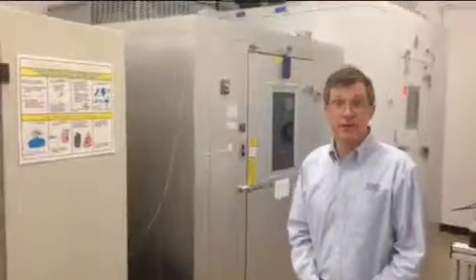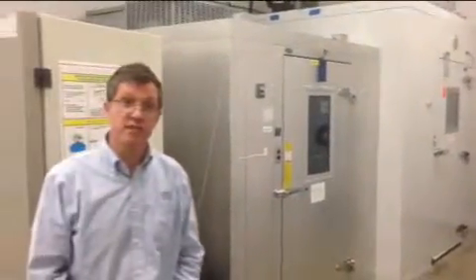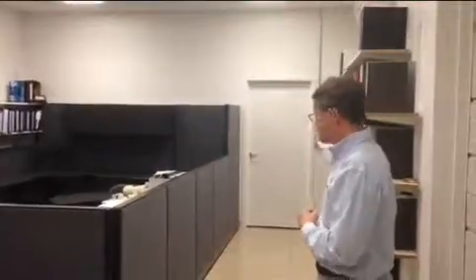This is our freezer area. We have standalone freezers and we have 2 walk-in freezers. All of these are monitored. So this is an office space, and behind me is the archive and the server area. The LIMS system we use here is Watson.